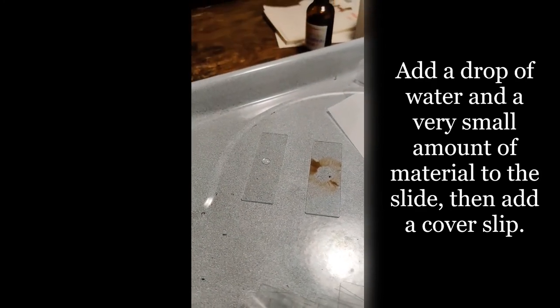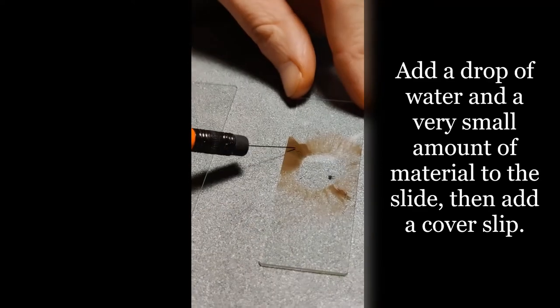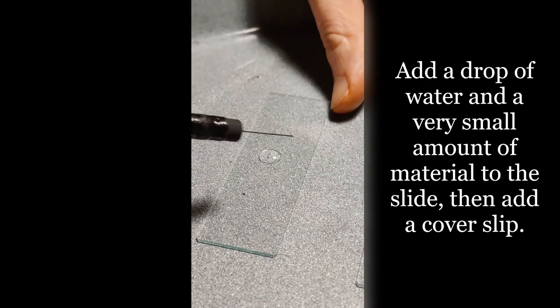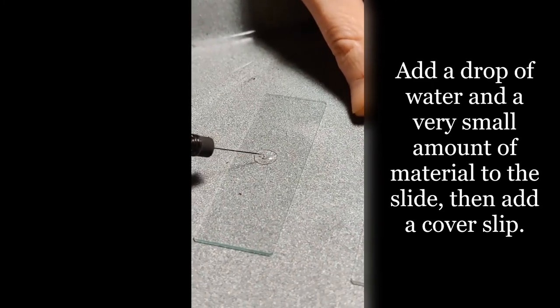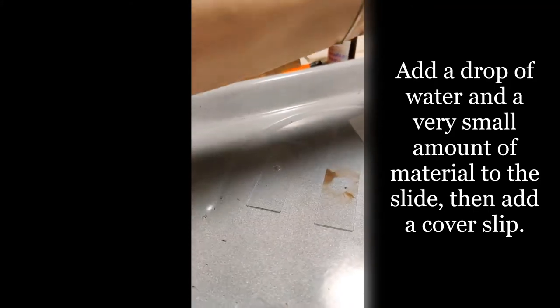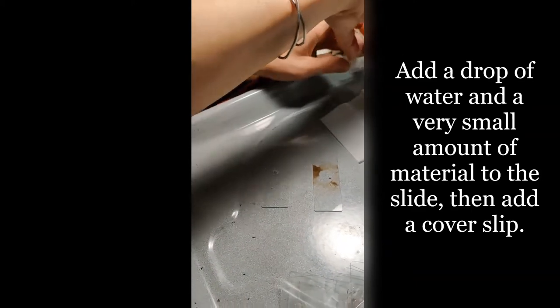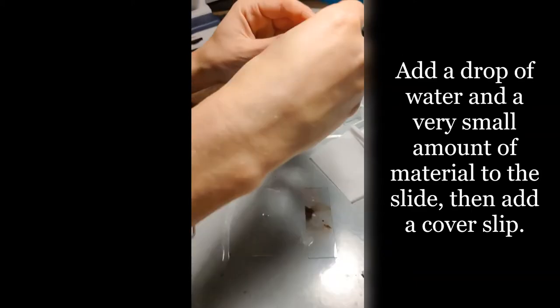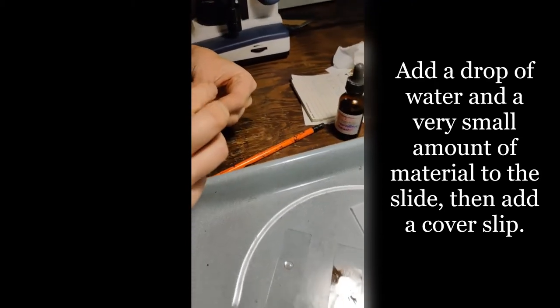Then I'm going to use my little doohickey and scrape some spores, and I can see that I've got some on the drop. Then I'm going to get out a cover slip, trying not to touch it too much with my hand.